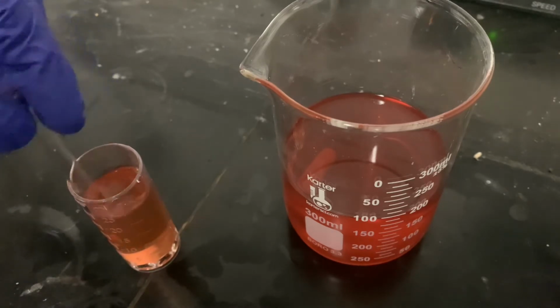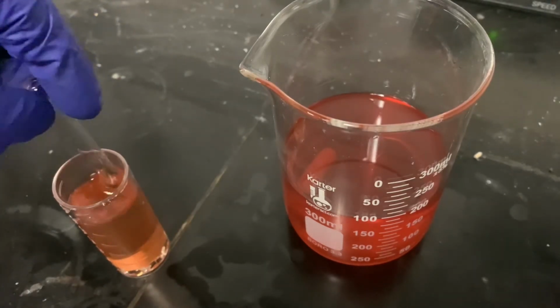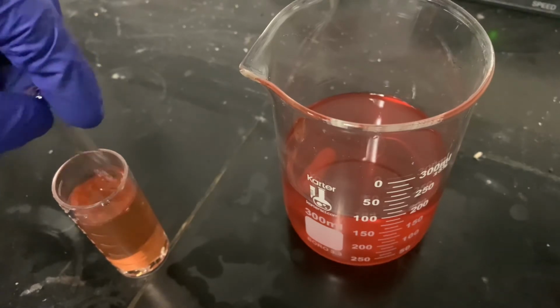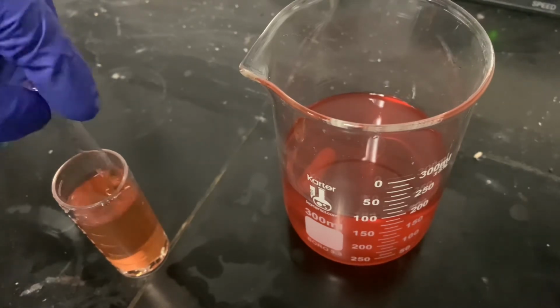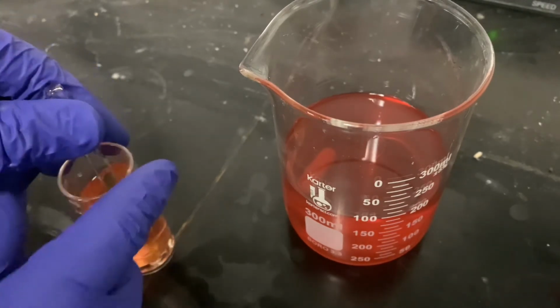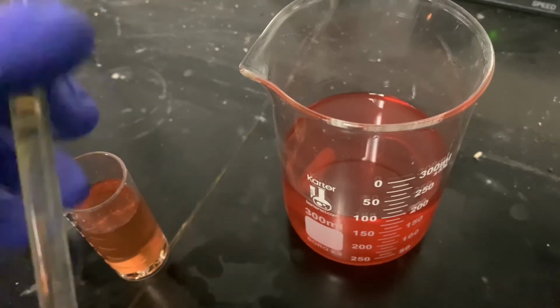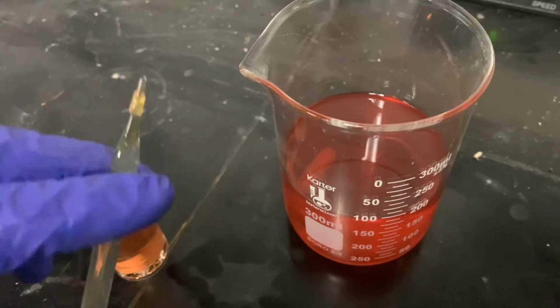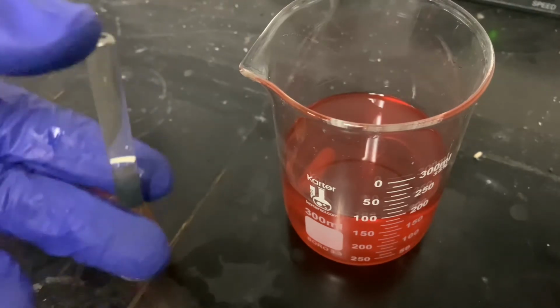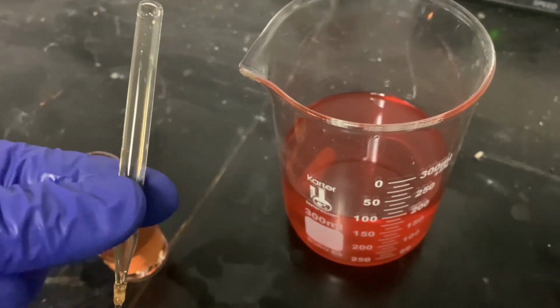Even though it is more product and the last two look like there is 0 phenol left, we'll still run this. I'm stirring, letting all that orange on the end of the ampule dissolve. As you can see, the dark orange is gone. We're going to break the ampule, let it fill, invert it a couple times, making sure not to touch the tip because it may be sharp. You can see most of that color is gone. And we're gonna wait 60 seconds and then test it.